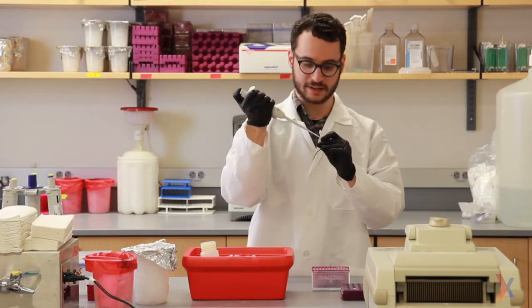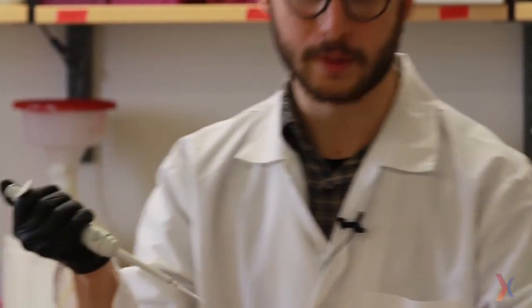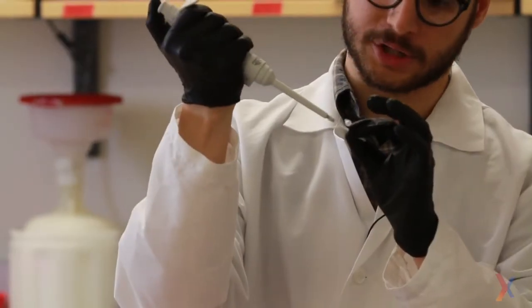The buffer is at a 10x concentration, and its final volume within the reaction should be 1x. So I'm adding 2 microliters to my 20 microliter reaction.